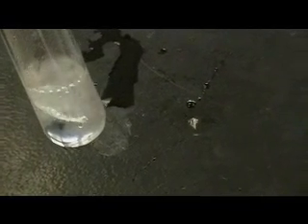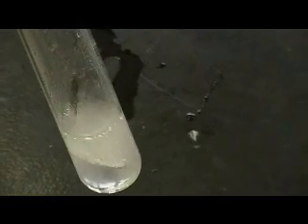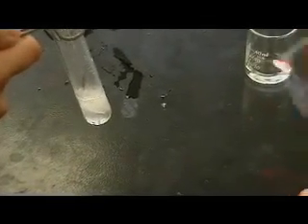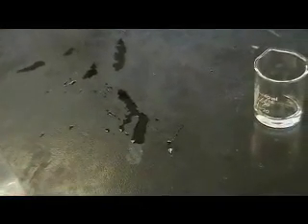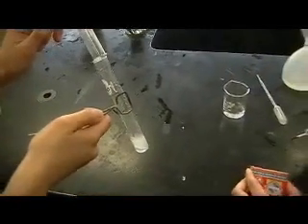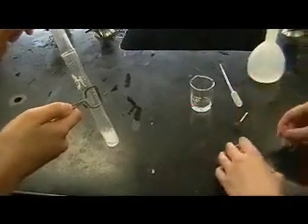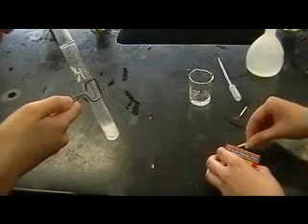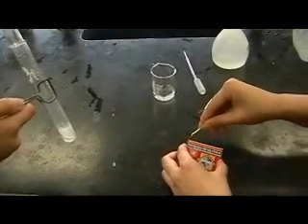By capturing the H2 gas bubbles with a test tube placed directly over the original test tube, we will be able to do a gas test to show that H2 has been produced by doing a lit splint test. Take off the second test tube that's on top of the test tube where the reaction is occurring, then simply take a match and place it directly under the other test tube.